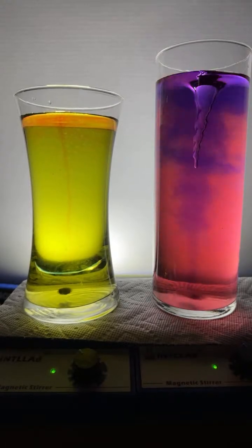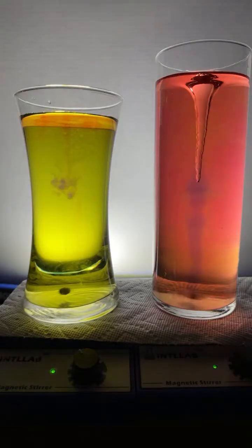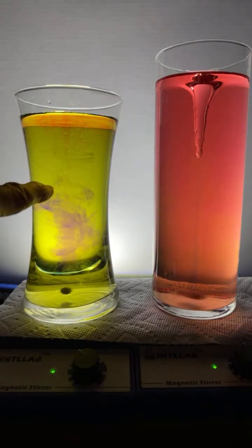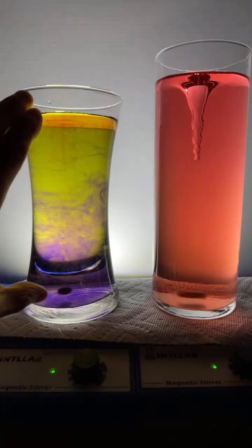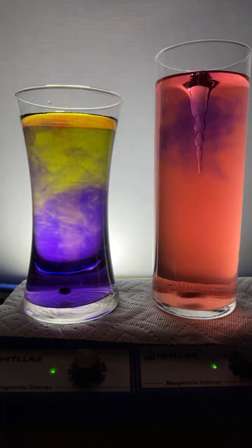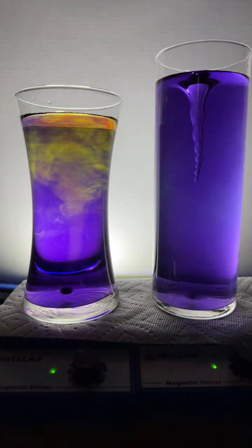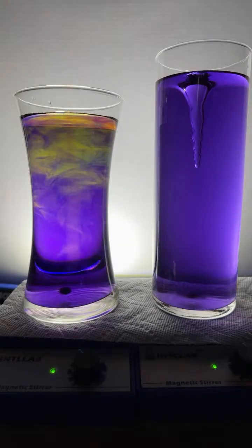So what's going on, that angry British kid? What we are doing is we are adding either base, which I'm just adding to this flask over here, to universal indicator, or I'm going to add acid to universal indicator, and we're going to watch what happens. Lydia, I do have some bromothymol blue, but it's mixed in with everything else in the universal indicator.